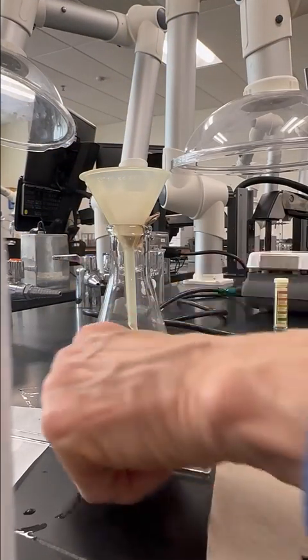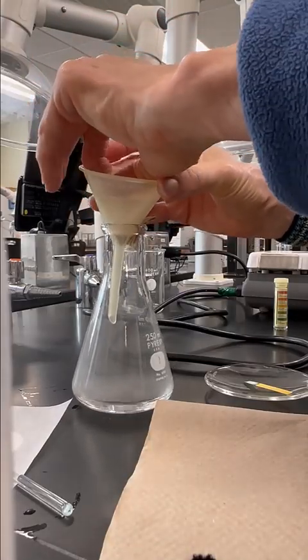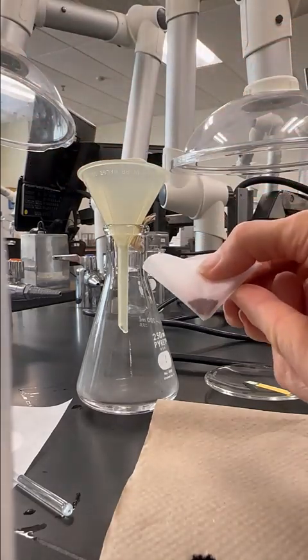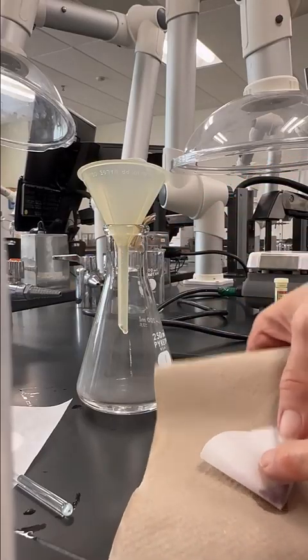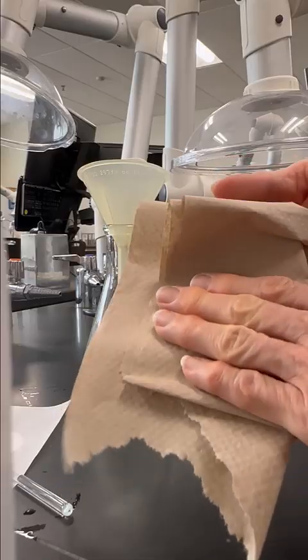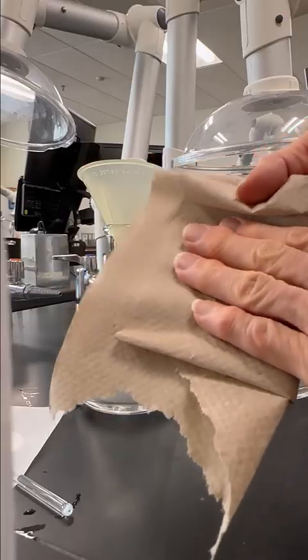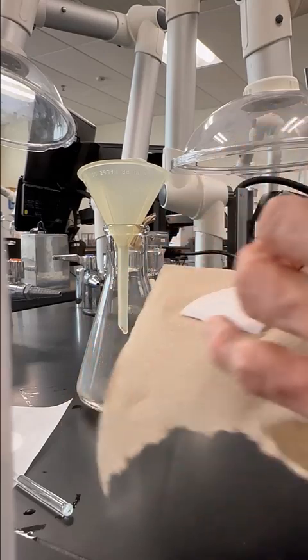All right, so I've got a piece of paper towel, and I'm just going to peel out the filter paper. You can use forceps for this, but you don't really need them. Now you can see the filter paper here. I'm going to place it in the paper towel, just like this, and flatten the paper towel around it, and take off as much of the solution as I can. It's mostly the acetone that's in there, but probably some water as well. I just want to pull off as much of that solution as possible.